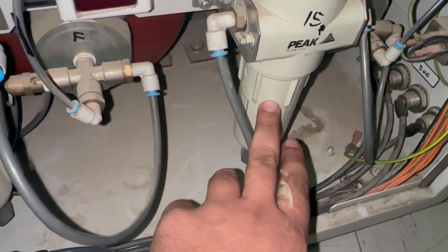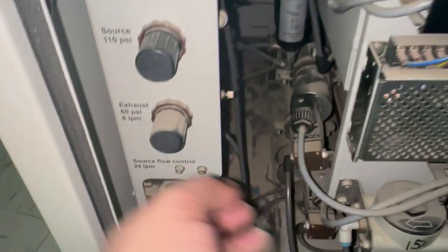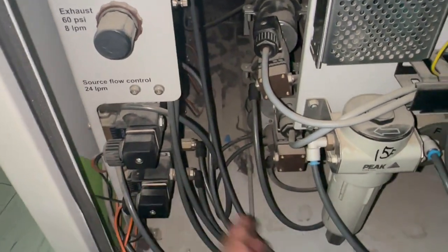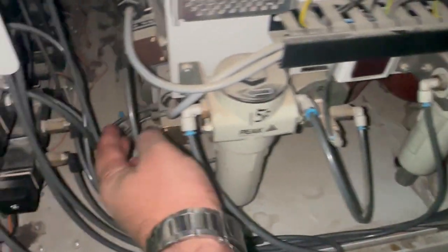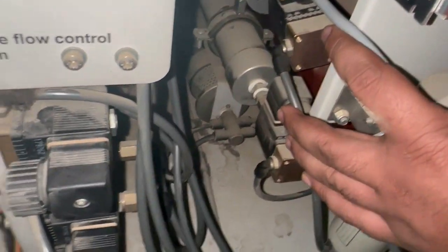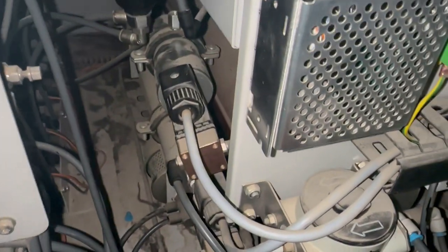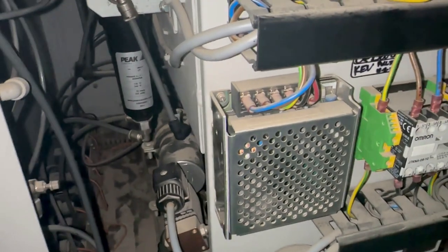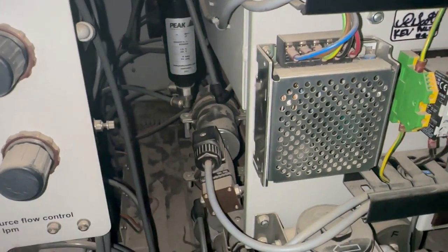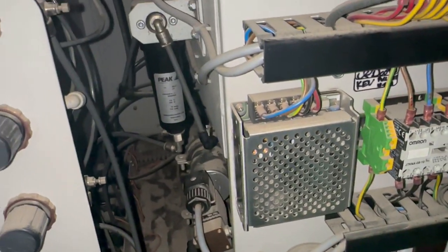This is the filter. Here we have another filter. So here we have the pressure regulators, and some valves, and the most important thing, here you can see the tank. So there are 2 tanks, one for nitrogen and the second one is for air. And here we have some valves, and the more important thing is the working of these valves. These valves should work properly, and not only properly, but in a specific sequence. If the sequence is disturbed, this system is not going to work anymore.